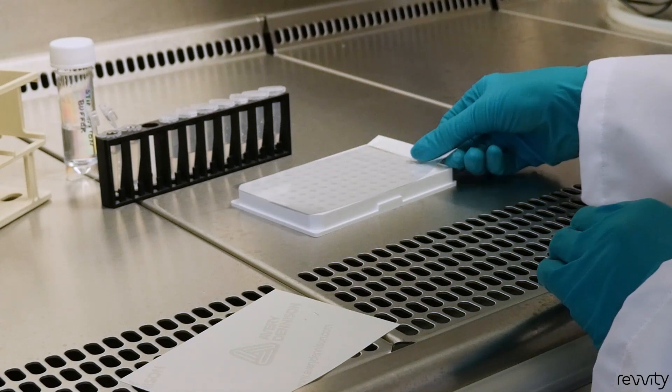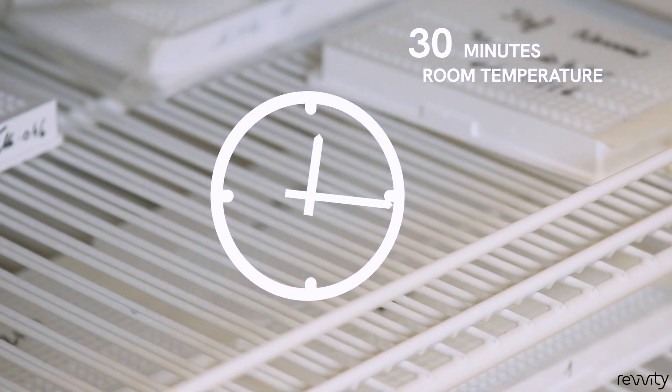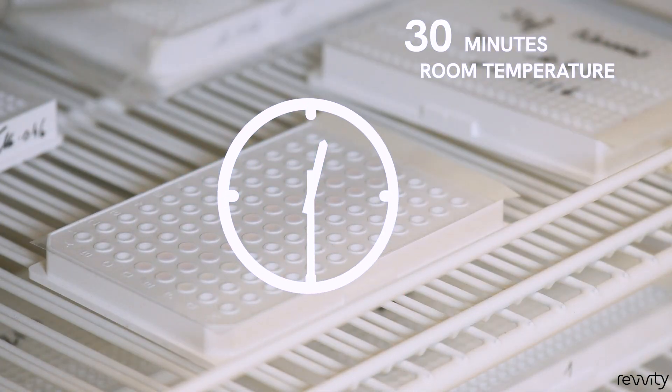Seal the plate and incubate at room temperature. Incubation is usually 30 minutes but can be longer depending on the compound used.